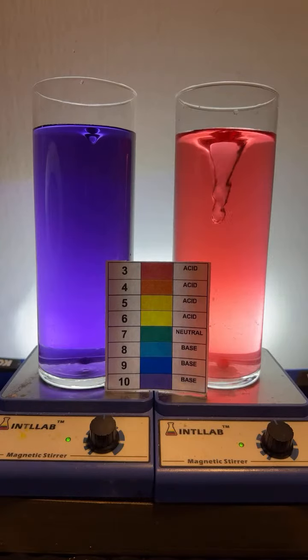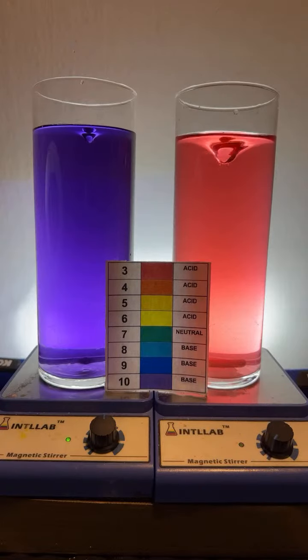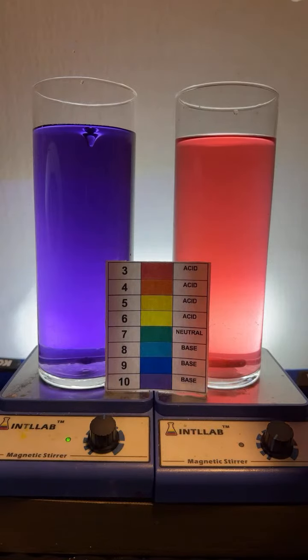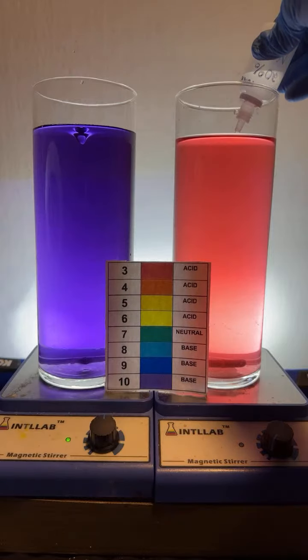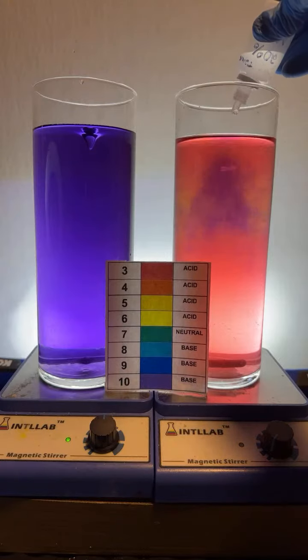So Anton, thank you there, P4 Unks. I'm going to go ahead and turn this one off. The acids and bases I'm using are 20% by weight sodium hydroxide and 20% by weight hydrochloric acid. So this is for you, Anton. I'm going to add some 20% by weight sodium hydroxide to the flask on the right. We're going to let that set.